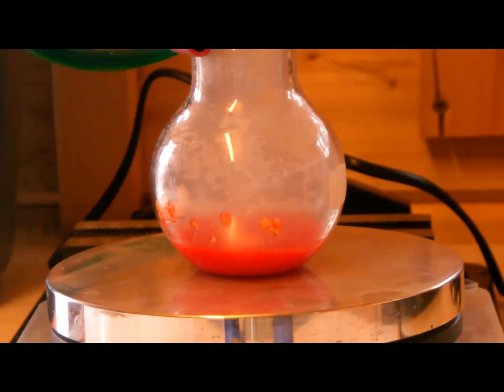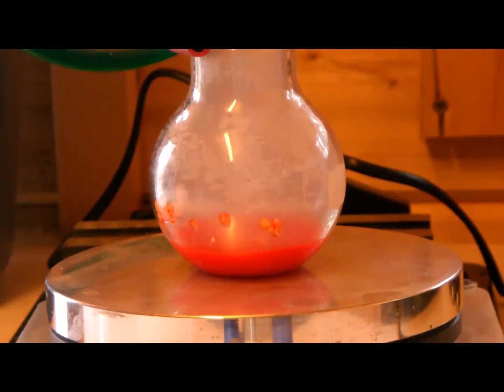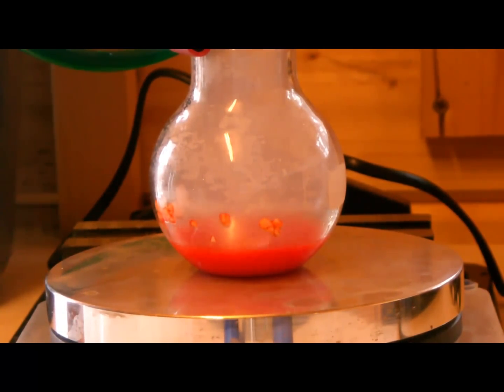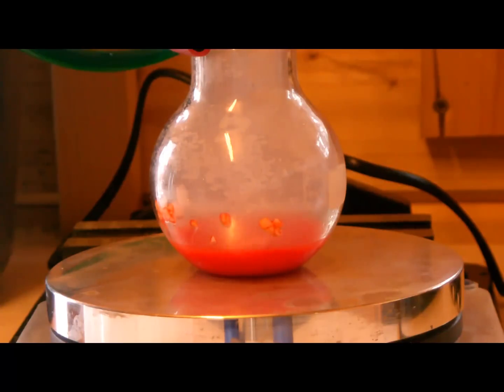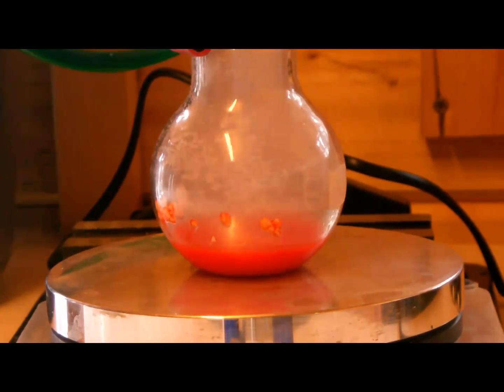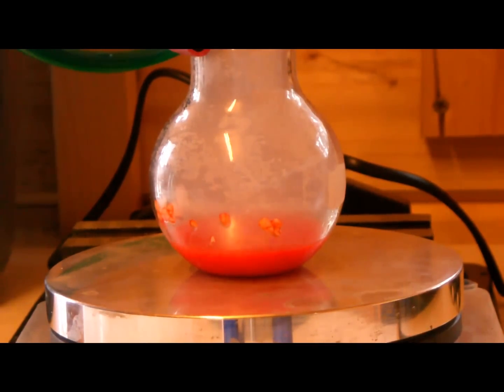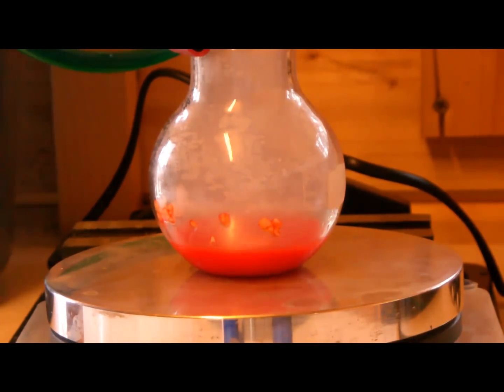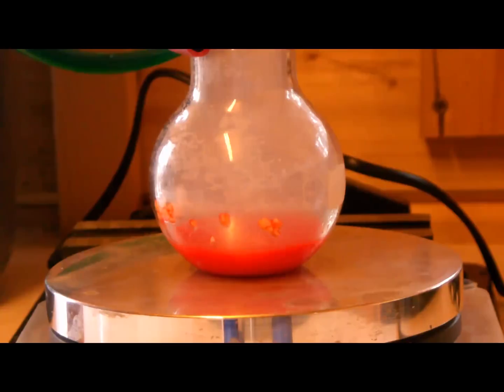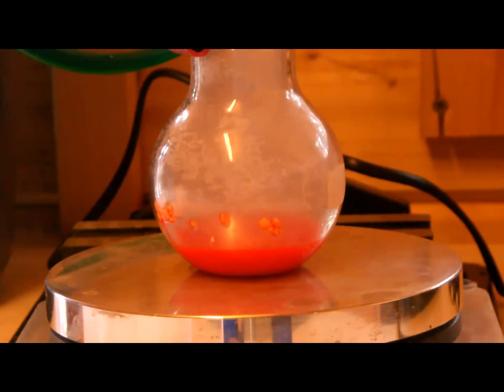So I think we are done. Mostly all the phthalic anhydride is consumed. There are a few crystals on the wall which I try to get into the solution. You can see this deep red color which comes from the phenolphthalein under extremely acidic conditions, because sulfuric acid is a very strong concentrated acid. It protonates the phenolphthalein very strongly, and the protonated form is deep red.